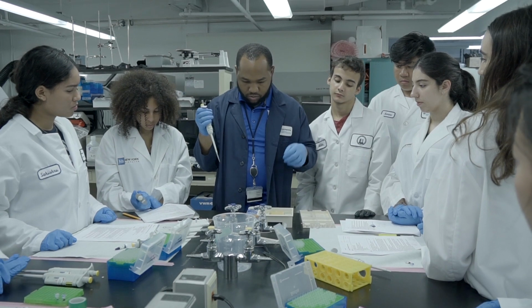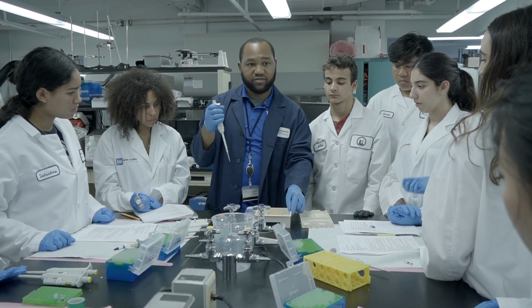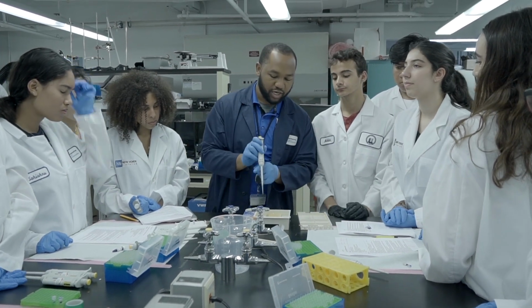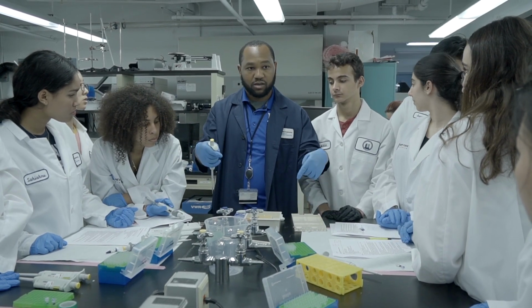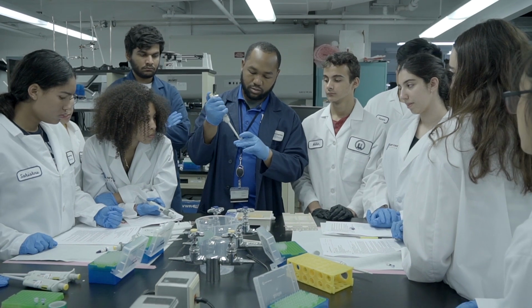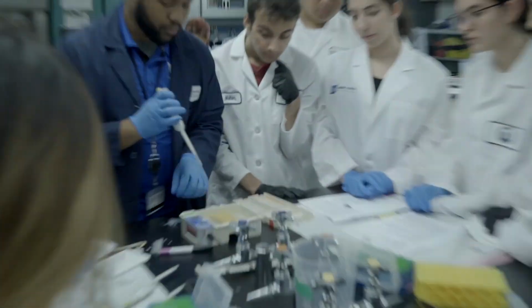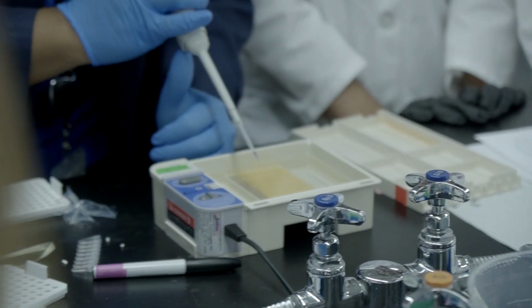All right, so this is my ladder. All right, if you can't see very well, please come here. So I'm going to basically be injecting here. If you are on either side, you will be able to see as it goes in, all right? Okay, so 10 microliters, going in the first lane.